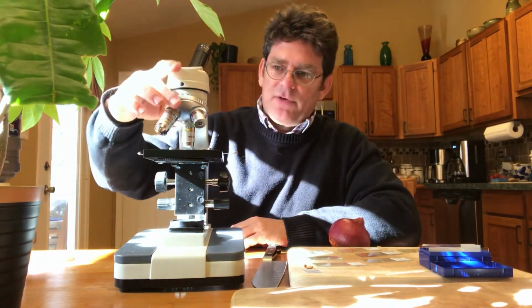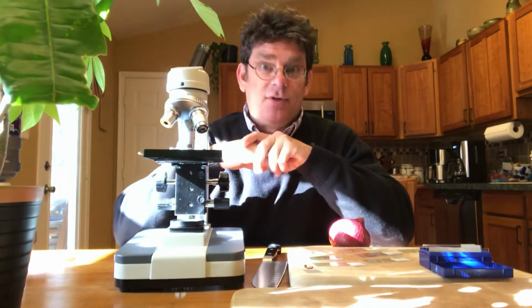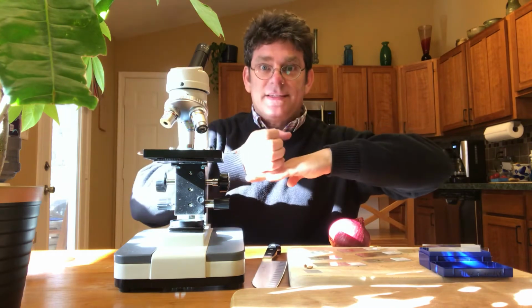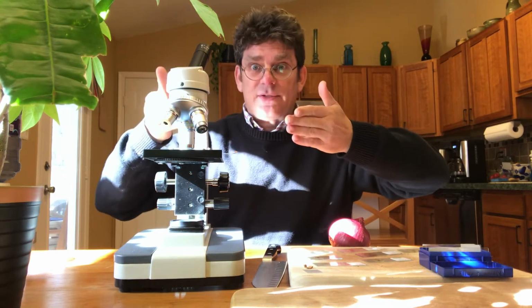Again, why do I need a cover slip? When I go to high power, the length of that lens is almost going to be right on top of the slide. That's not a design flaw, it's just the way light microscopes are. So that lens, imagine if I just took the leaf and just dragged the lens into it, right? The leaf's going to dry out, it's going to stick to the lens. So a cover slip also protects on high power.